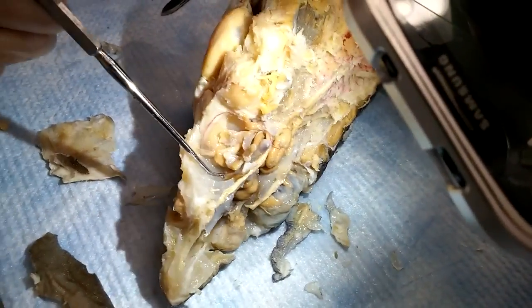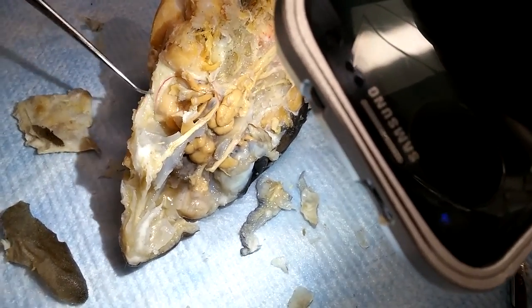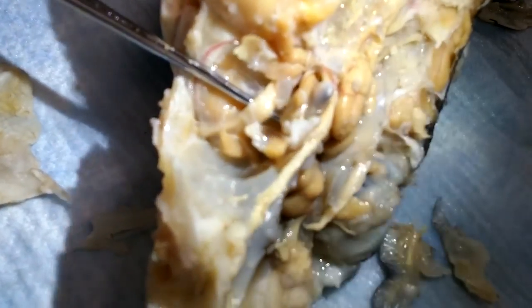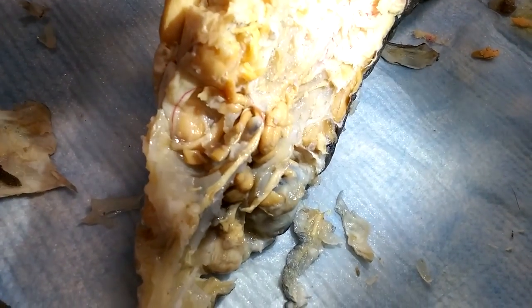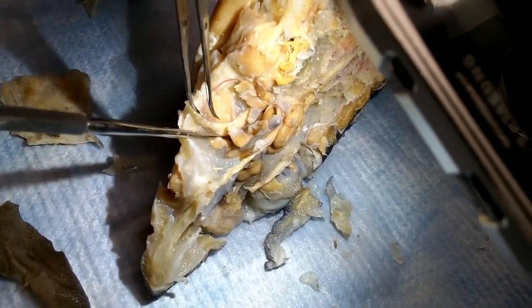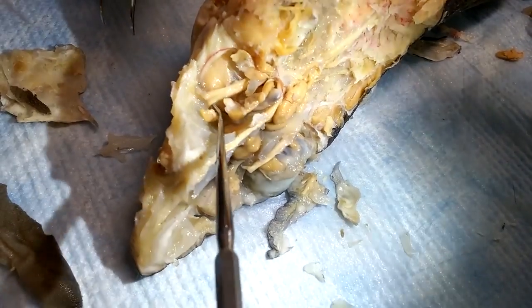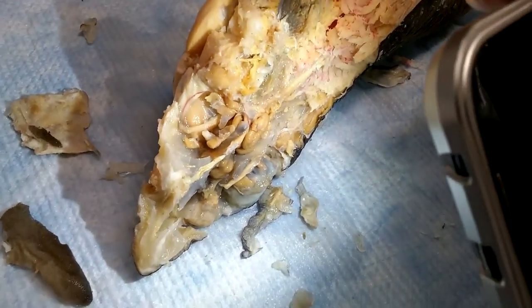Then we have — sorry, I have to look for it. Right here, this one right here is the infraorbital nerve, and then it separates. This part right here is the buccal, so the infraorbital separates into the buccal, which is this part. And then right here, where my pointer is, that is the maxillary. And that's it — I didn't really go in order, but you guys know.